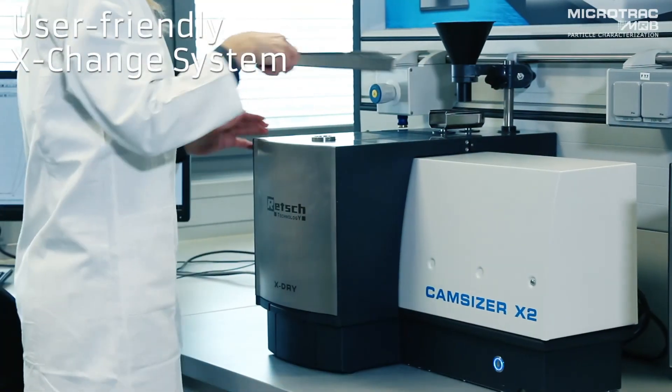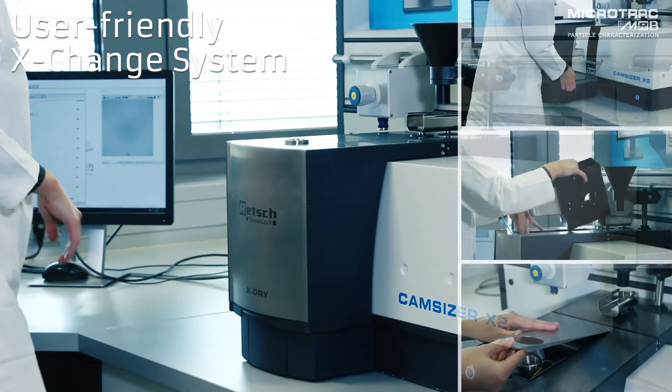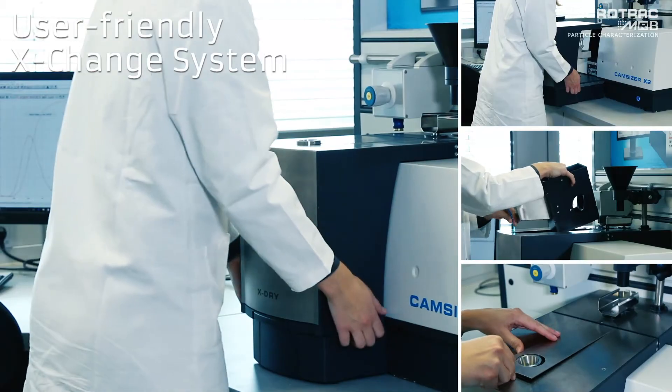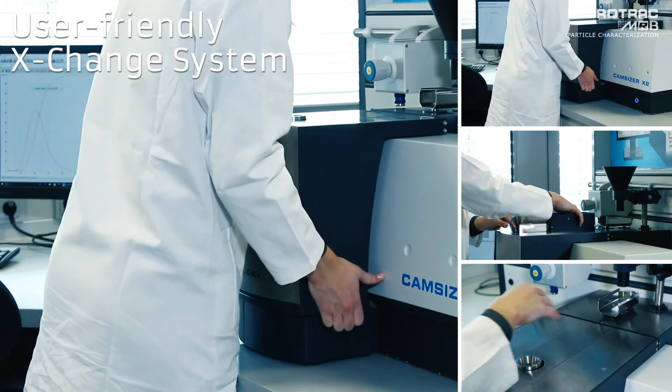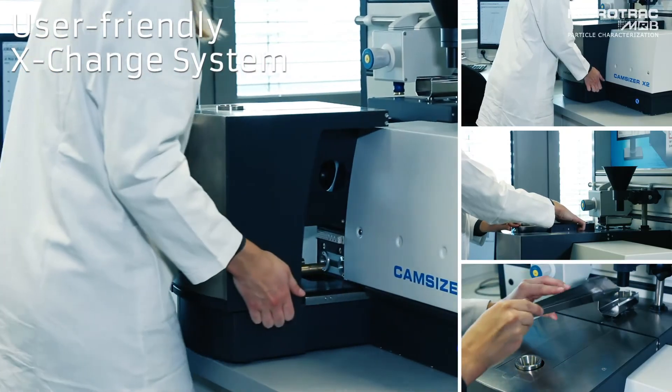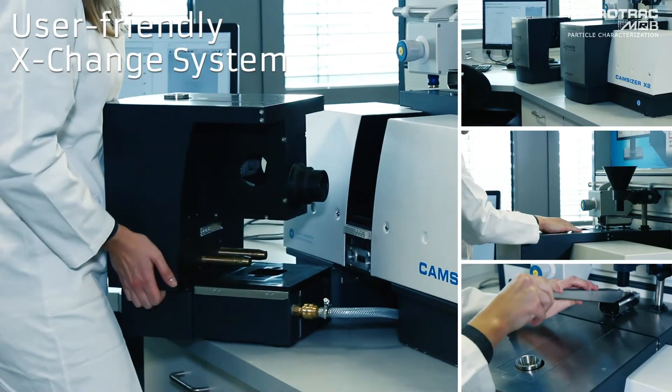Thanks to the user-friendly exchange system of the CamSizer X2, the three dispersion units can be exchanged quickly, safely, and without effort.